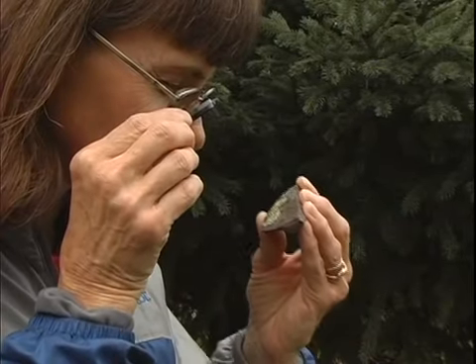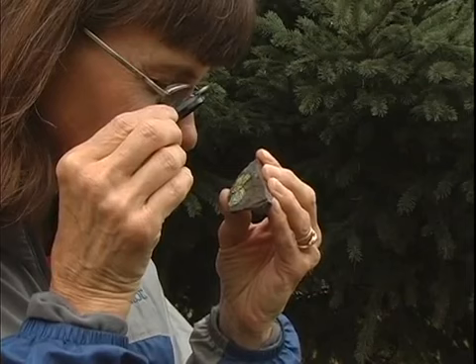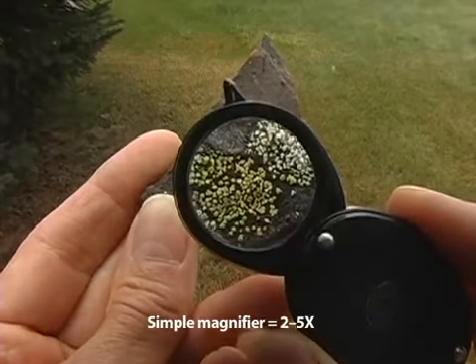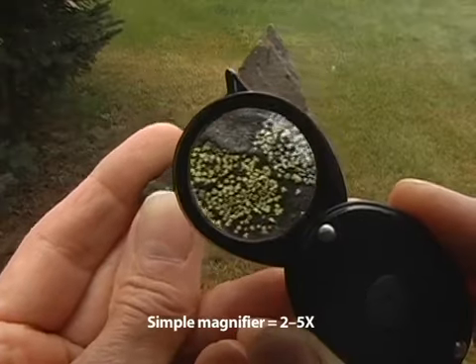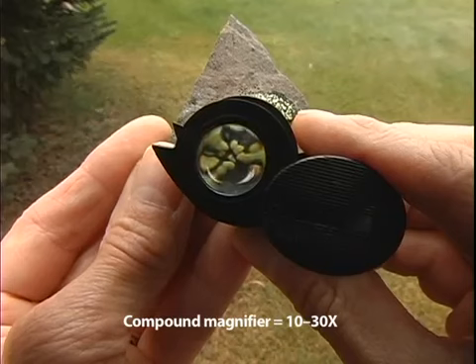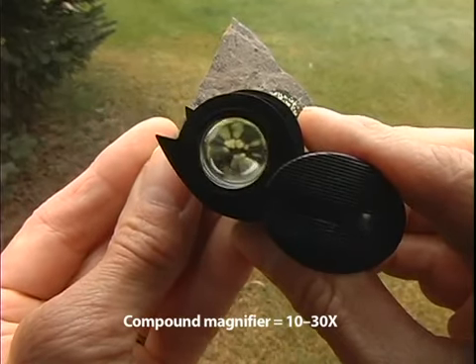The simplest way of making an enlarged image of an object is to use a magnifying glass or lens. A single magnifying lens produces an upright or erect image that is enlarged 2 to 5 times. With 2 or 3 lenses together, a compound magnifying lens can produce a magnification of up to 30 times.